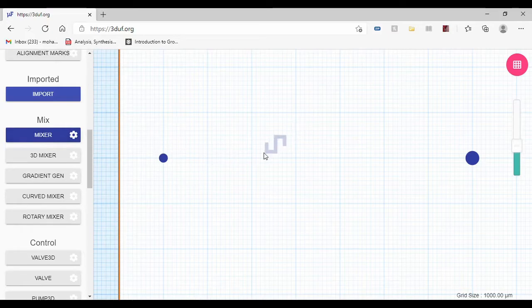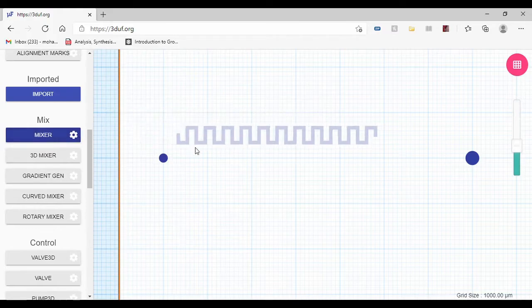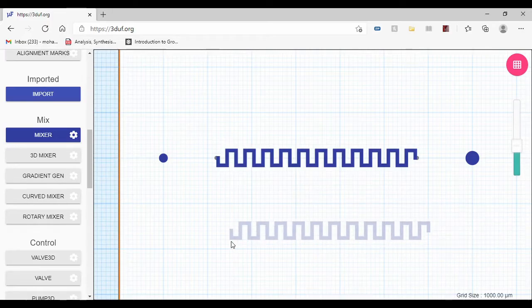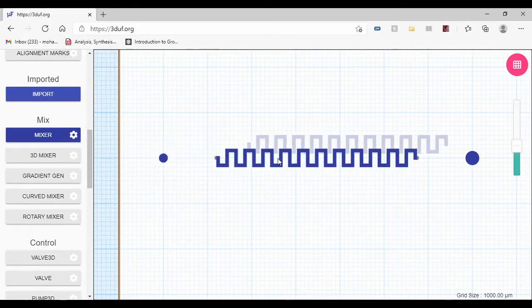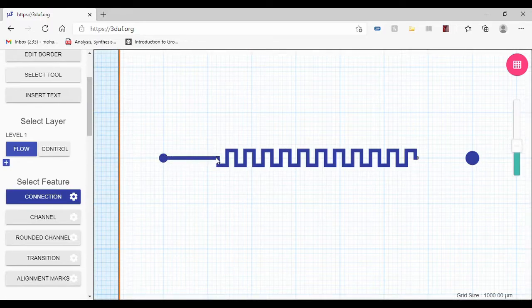Now my mixer is horizontal, but the next thing I want to do is increase the number of bends, so my mixer is a bit larger. I'm going to put the mixer right here. Then I want to connect the ports to the mixer. So I'm going to go to connection, click on the port, and click on the first side of the mixer. This connection feature is still active, so I just have to right click to disable it. Then I can go to the other port and connect it to the other side of the mixer.